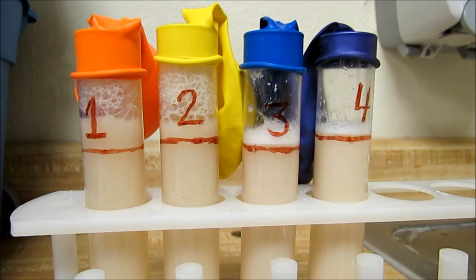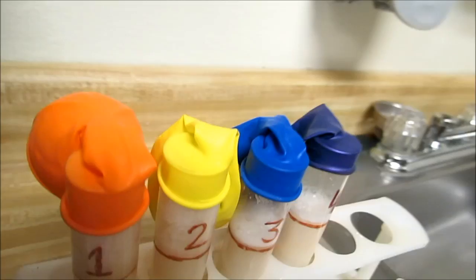Okay, so we have made it to the 15-minute mark, so we should be taking another observation here.